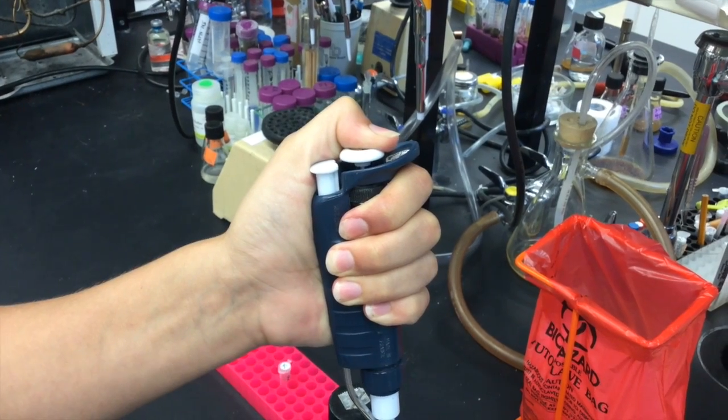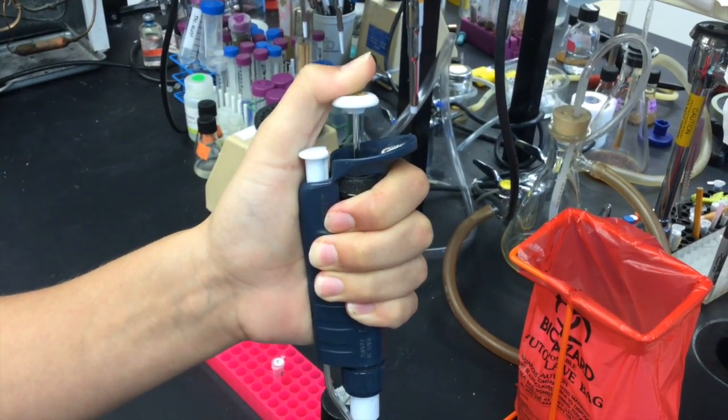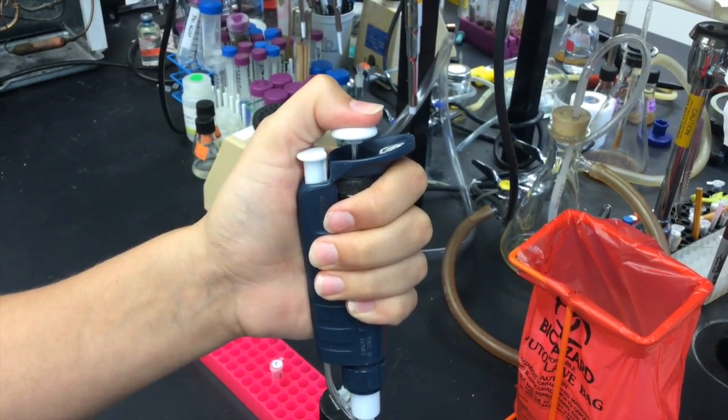It is important to remember that when preparing to draw up fluid, you cannot go past the first stop.